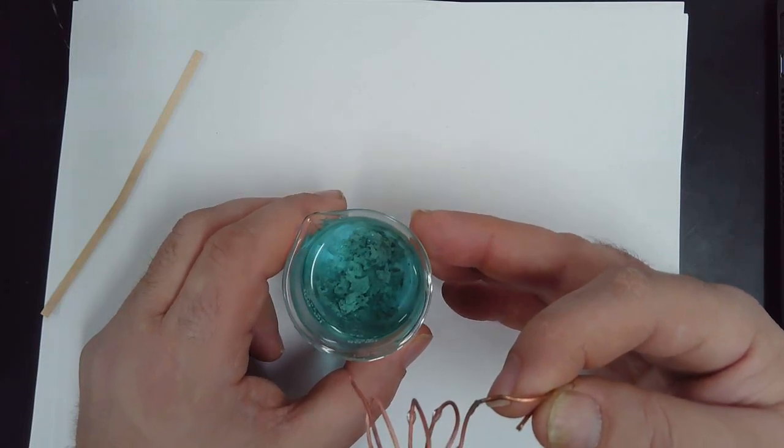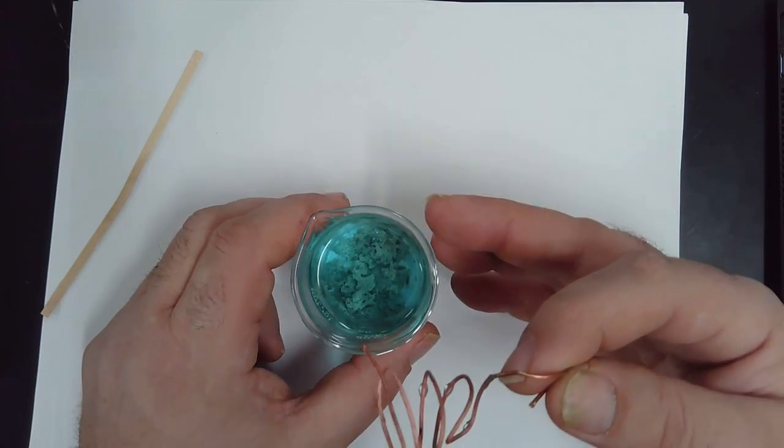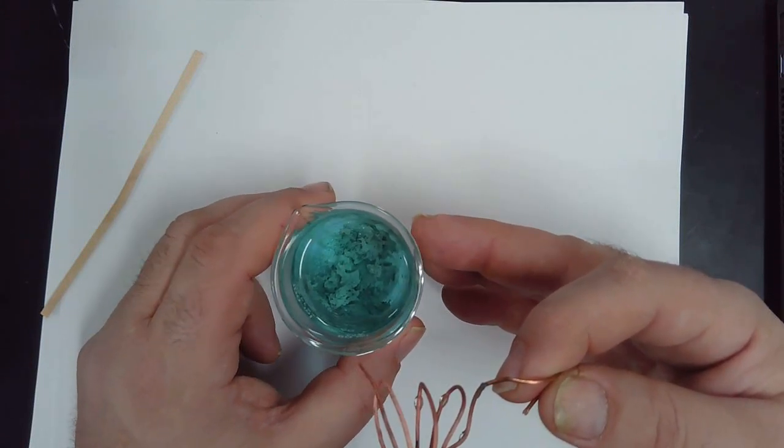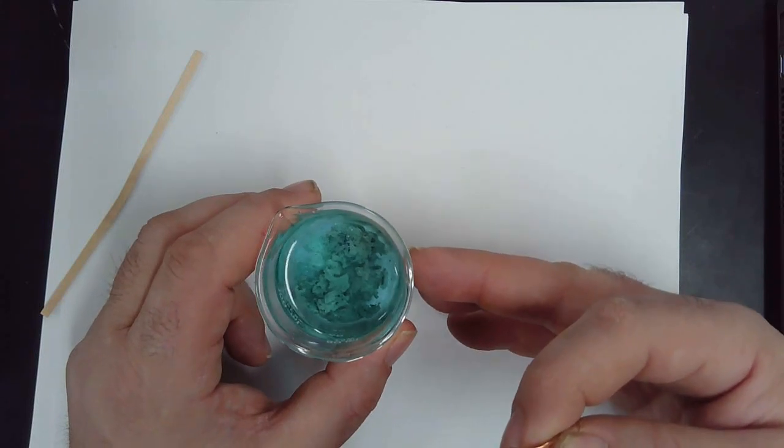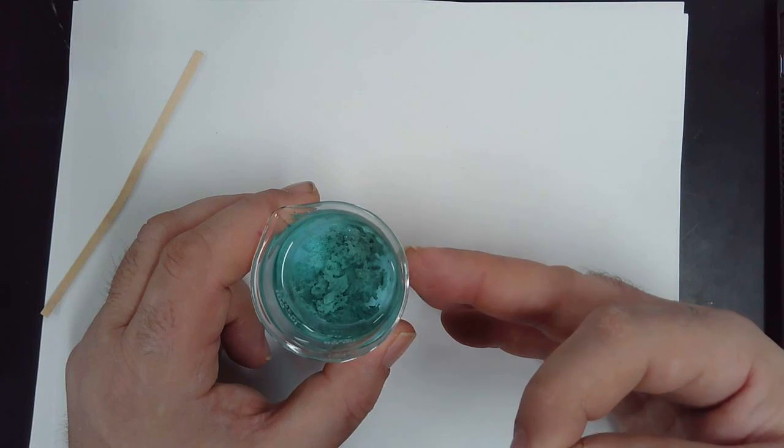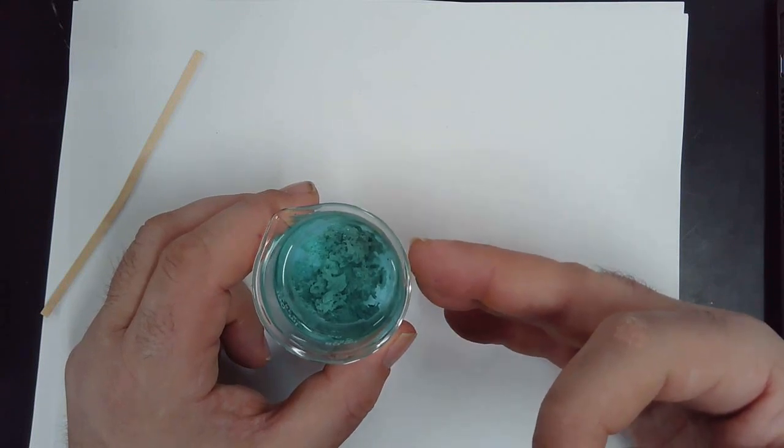My expectation is you will decant all of the liquid out of this beaker, and then you will use distilled water and rinse this product and decant three times after you have decanted this liquid out.